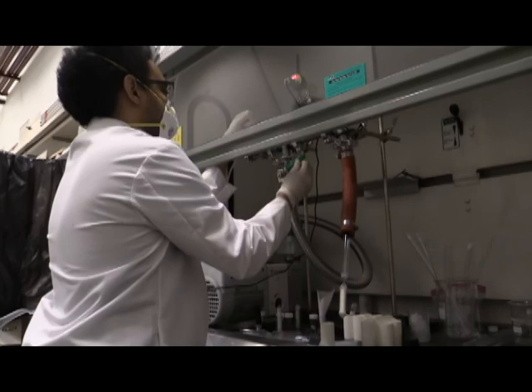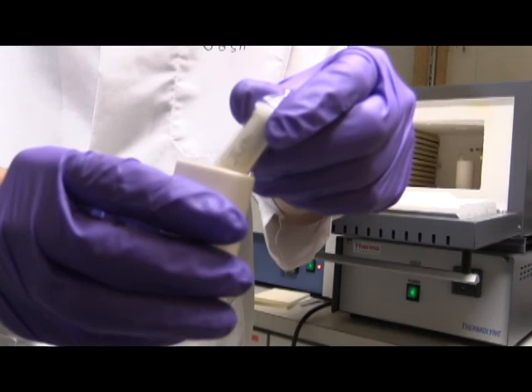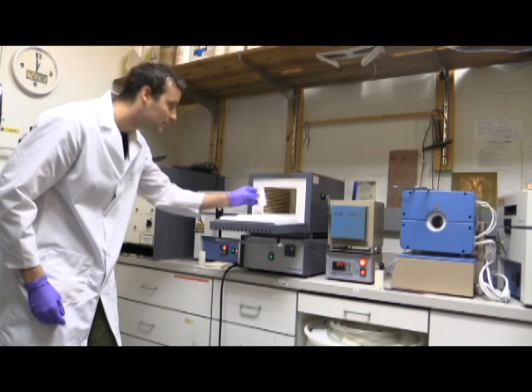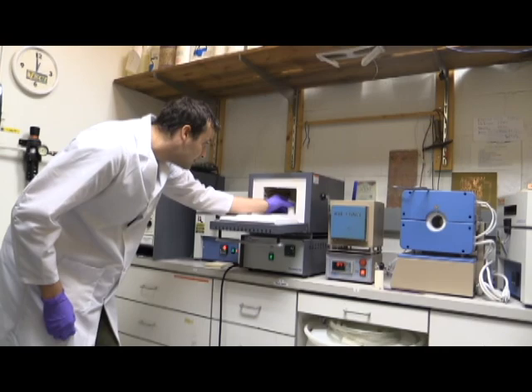At this stage, the sample is ready to be entered into the furnace. We use different kinds of furnaces for different crystal growths and often have more than 10 kinds of crystals growing at a single time. A growth can take between one and three weeks or sometimes even longer.